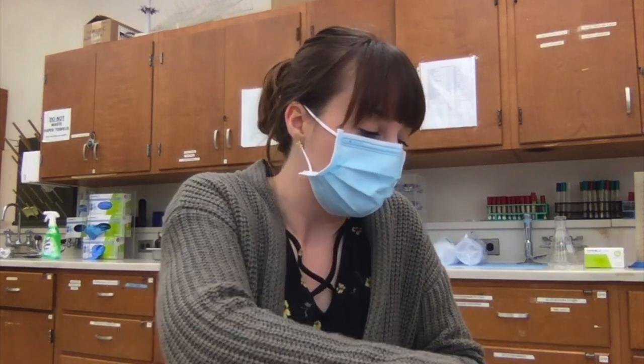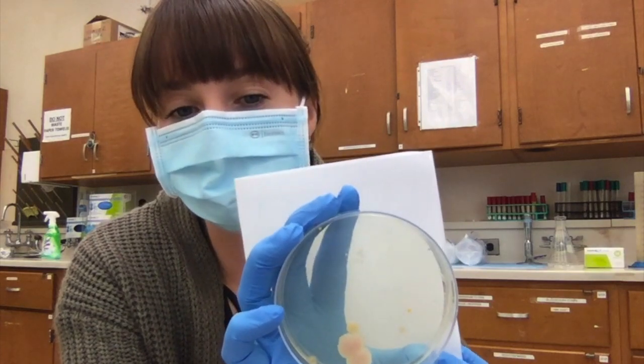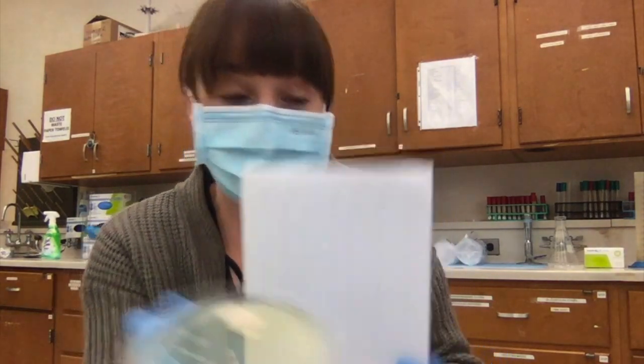The major problem that we experience is contamination, and what that usually indicates is that the person wasn't by a burner or in a sterile environment. And so what we can have is a plate that's already growing bacteria, something like this, and it could not be used to grow or isolate colonies on it.